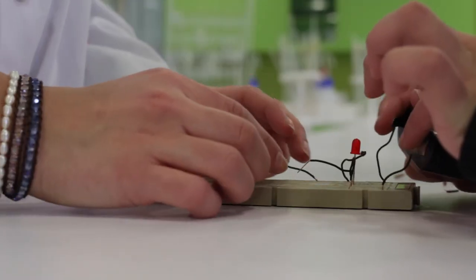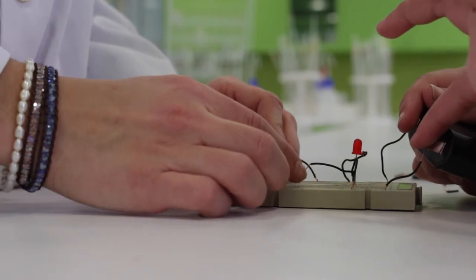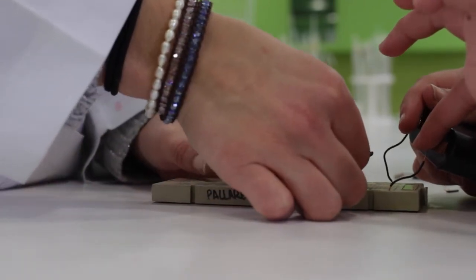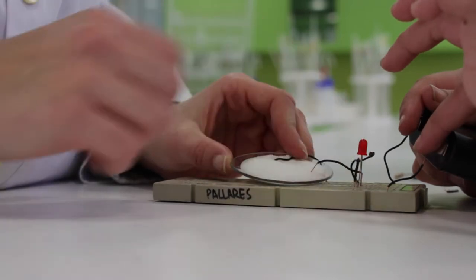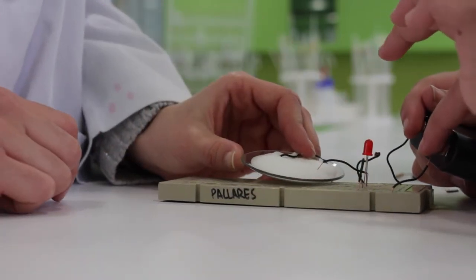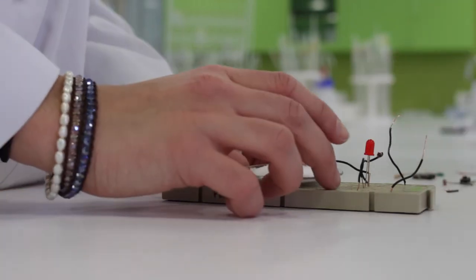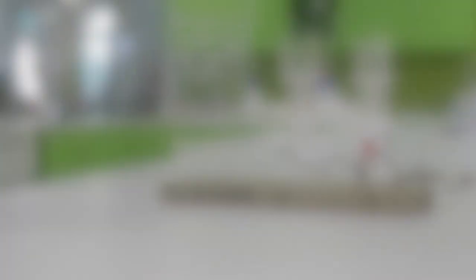Finally, we will repeat the process for the kitchen salt. We see that when it's attached to the system, the light bulb doesn't turn on, and so it doesn't conduct electricity. Here's a recap of what we've obtained until now.